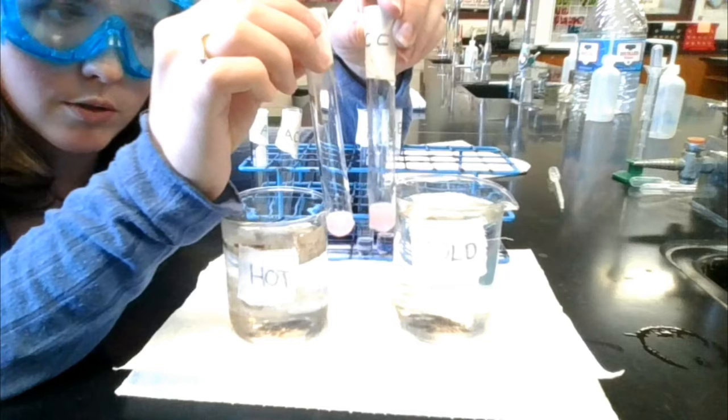So as you can see, this solution did not change color in the heating or cooling bath. It stayed the same white, cloudy pink. This is because, as I talked about previously, all the chloride was pulled out whenever we added that silver nitrate. There's no chloride left in the solution. This means that all you have in there is cobalt hydrate. You cannot form cobalt tetrachloride, and there is no cobalt tetrachloride.